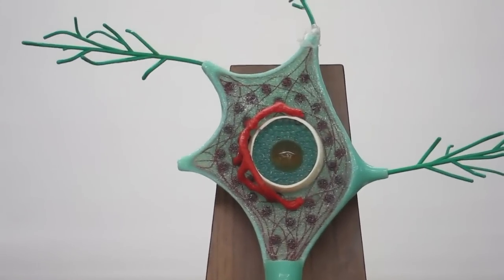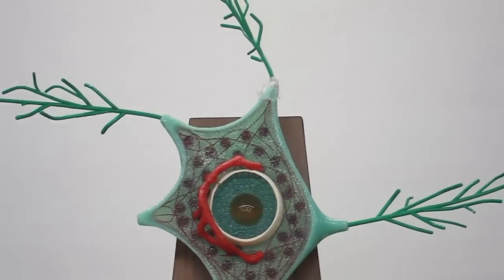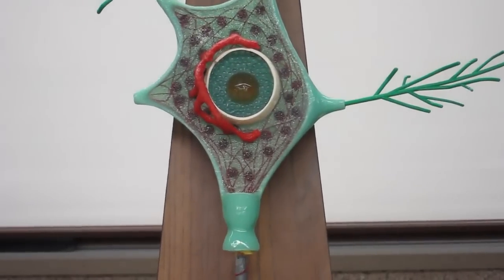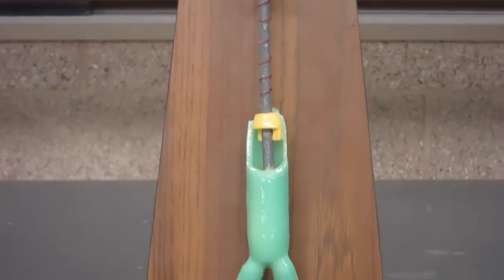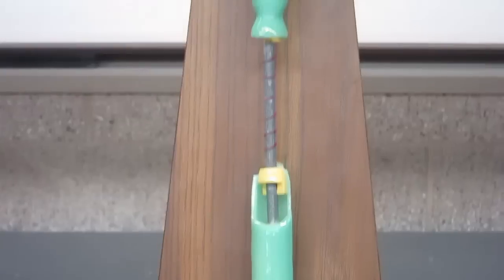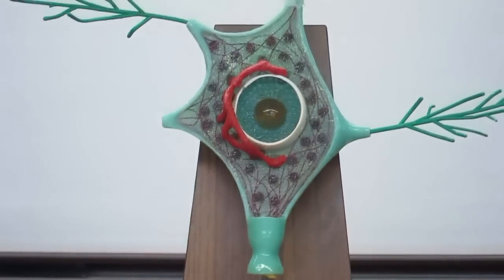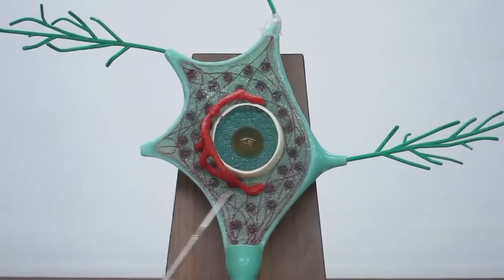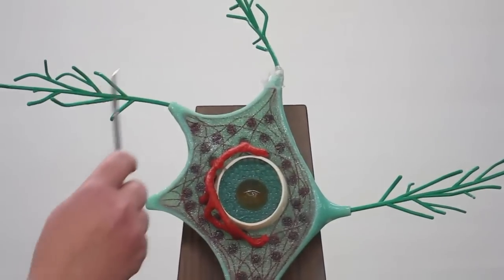We're here doing the Lab 10 material. This section will be looking at the structure of the neuron, and we have a multipolar motor neuron here. We can tell it's multipolar because it has several dendrites.